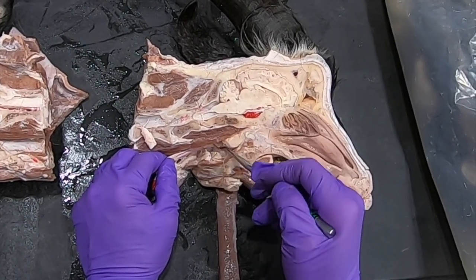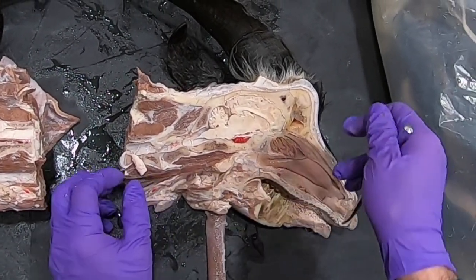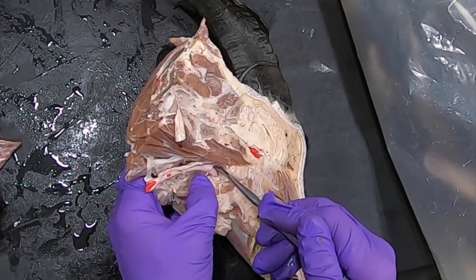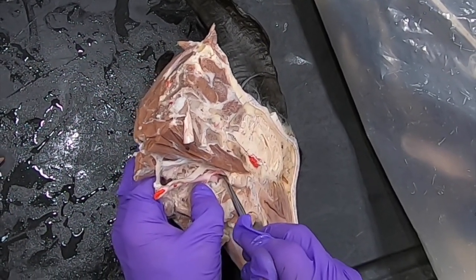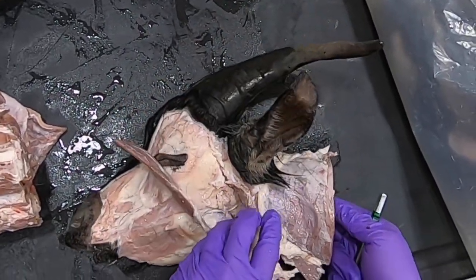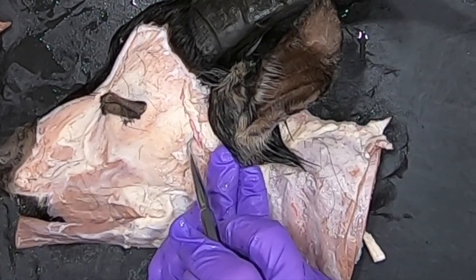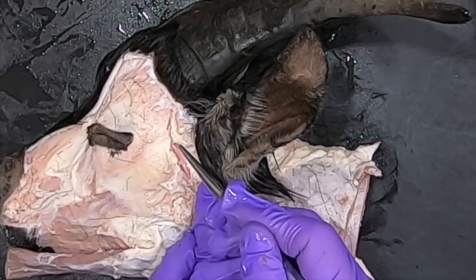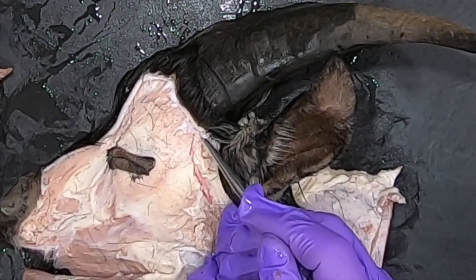In the goat we don't have a facial artery, so this is just the lingual artery. Following the external carotid up, it gives off a caudal auricular, and eventually gives off this branch here which is the superficial temporal. So the external carotid terminates as the maxillary and as the superficial temporal.